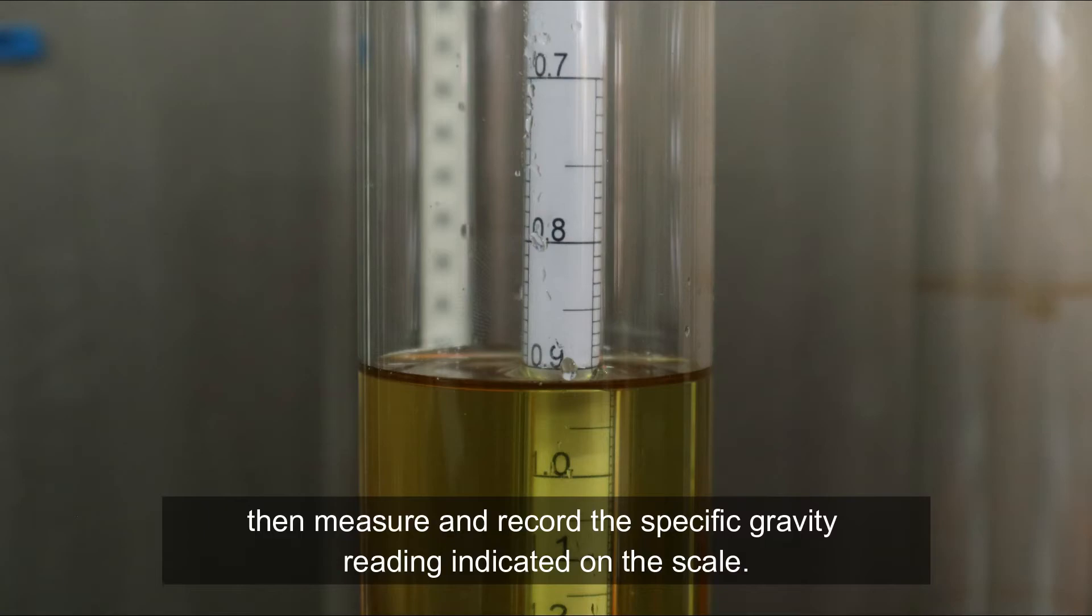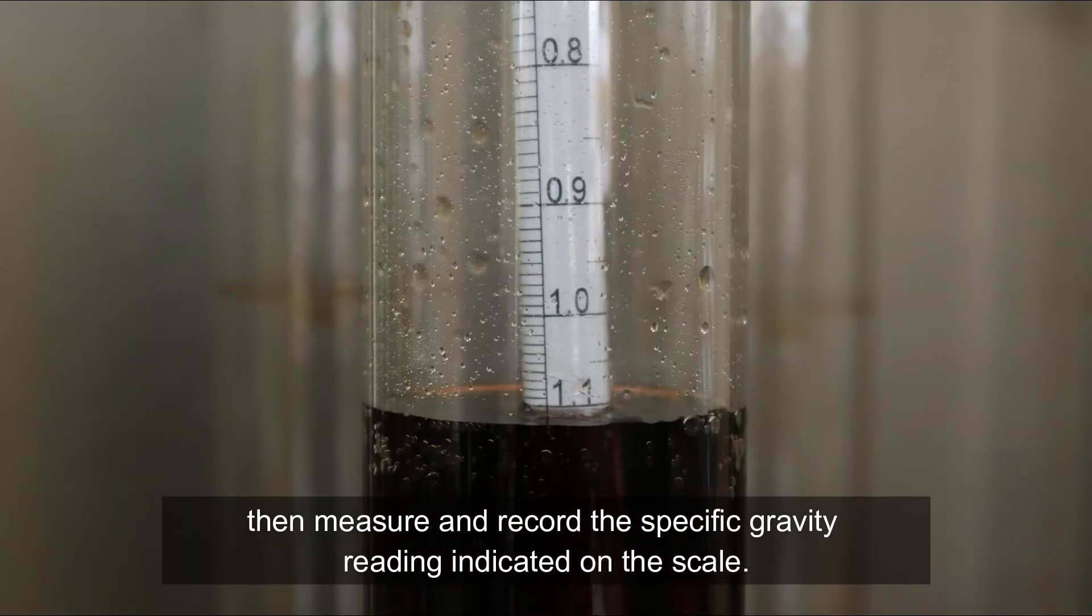Then, measure and record the specific gravity reading indicated on the scale.